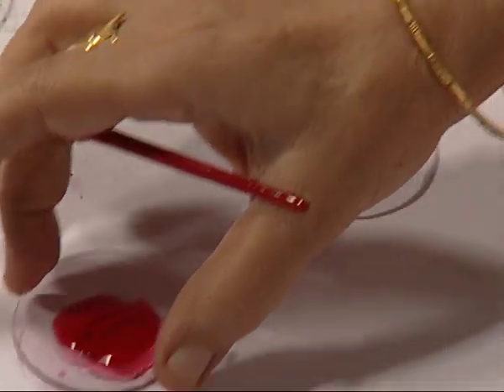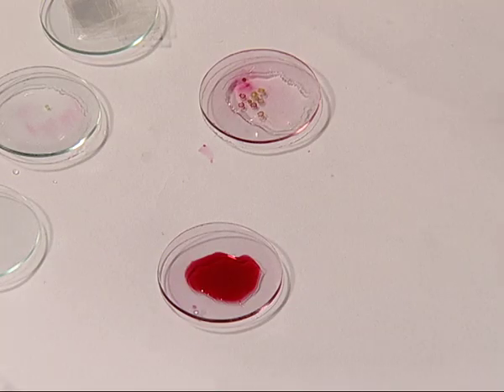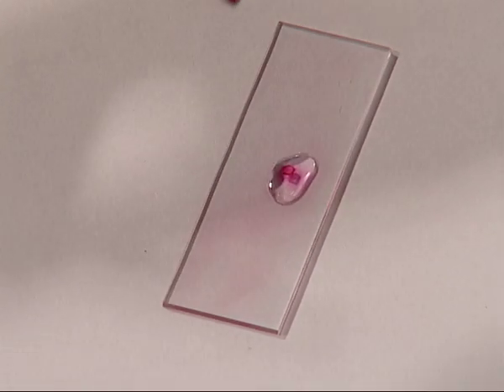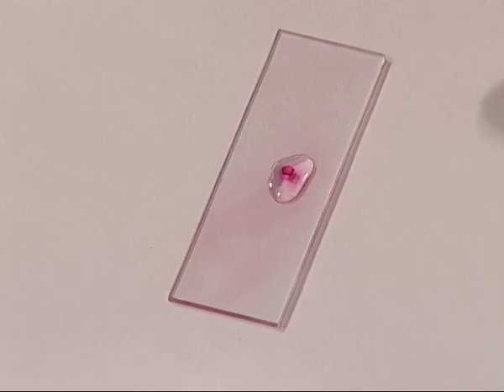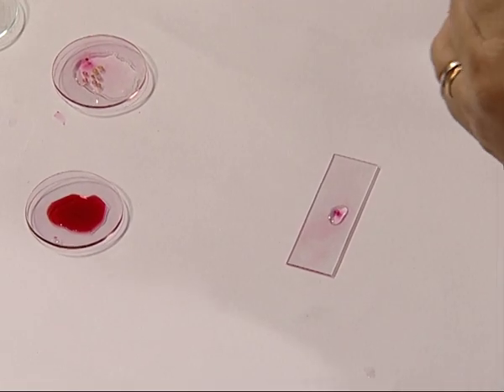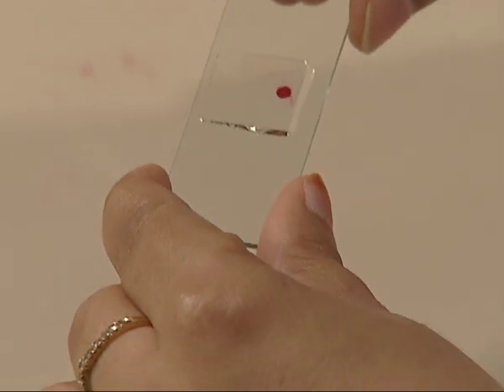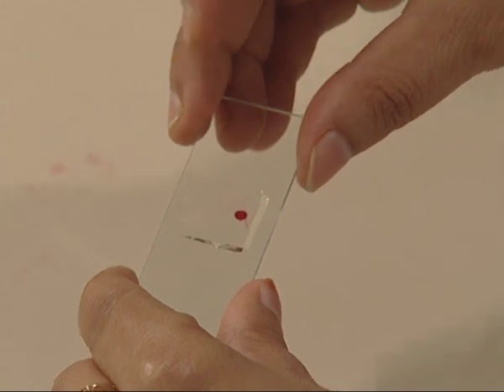After this, the sections are put on a slide. A drop of glycerin is placed on the slide, the section is placed on this drop, and it needs to be covered by a cover glass. The stained section has been mounted in glycerin and now it is ready to be observed under the microscope.